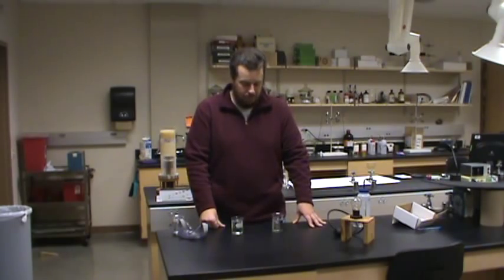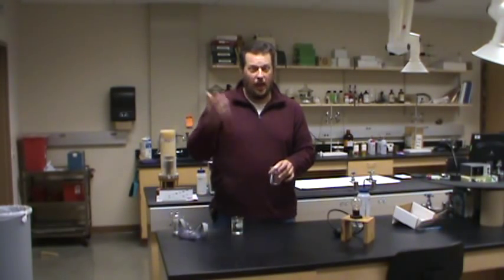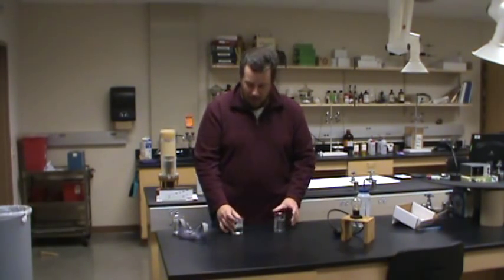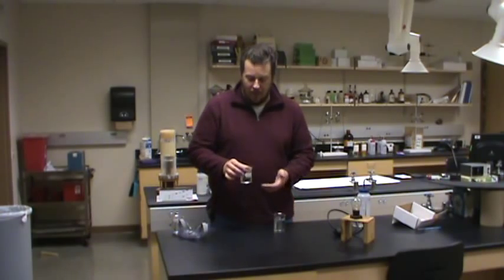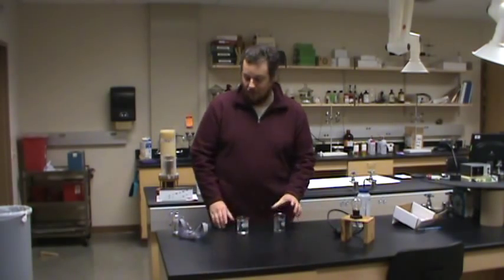We've gotten to a room where we can get a little darker to make it easier to see the light bulb on our conductivity tester. I've got two samples right now: a sample of deionized water from the lab taps, and another sample of water that I've added some salt to — something that'll dissolve and form ions.